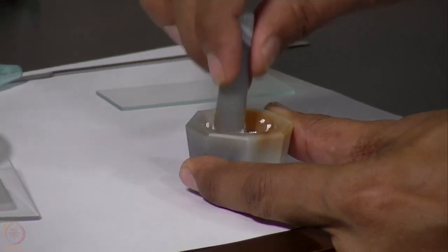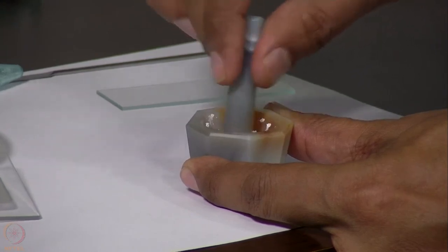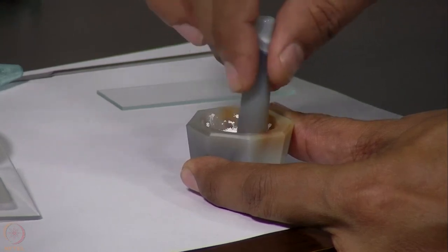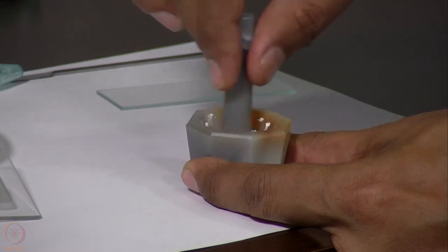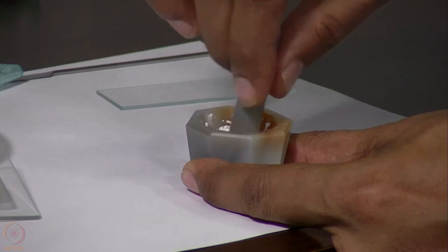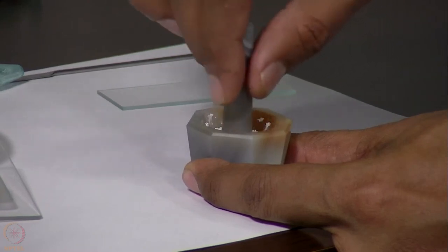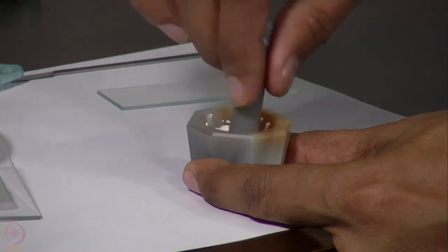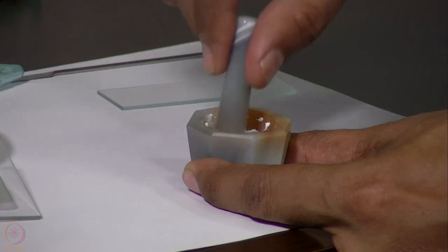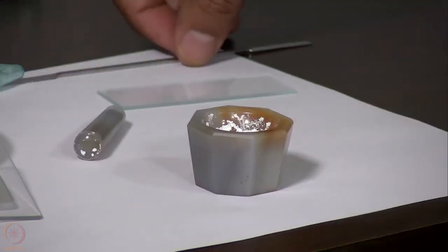This grinding should be done very carefully, and harsh grinding may lead to conversion of the sample to a different form. In case the sample contains some solvent, if we apply too much pressure during grinding, the solvent can evaporate and lead to a different crystal structure than the starting material.